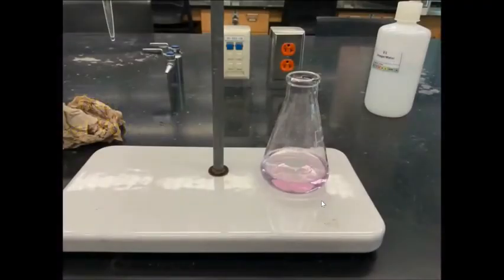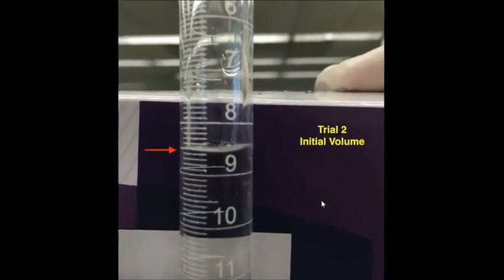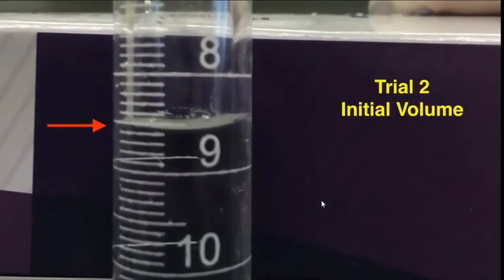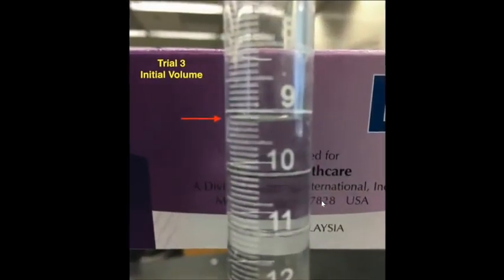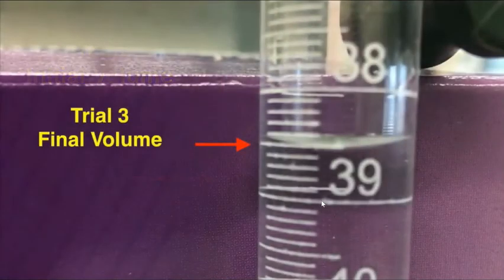This is the final color of the titrated solution about 1 minute after the end of the titration. We now repeat the titration 2 more times. Here's the initial volume of the sodium hydroxide for the second trial, and here's the final volume. And lastly, we have the initial volume for trial 3 and its final volume.